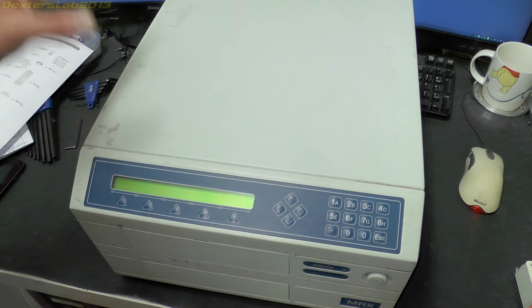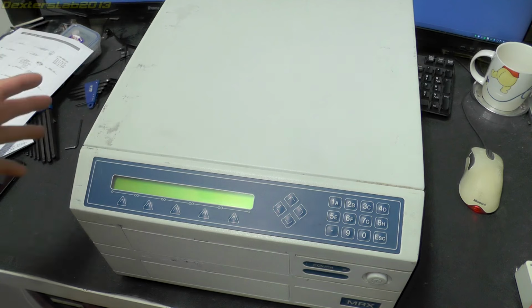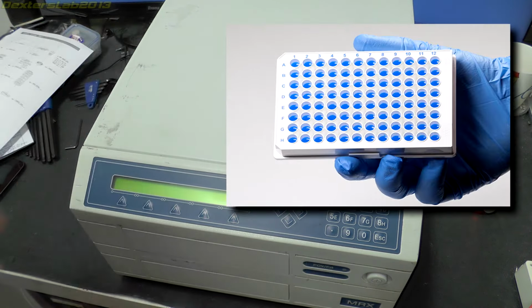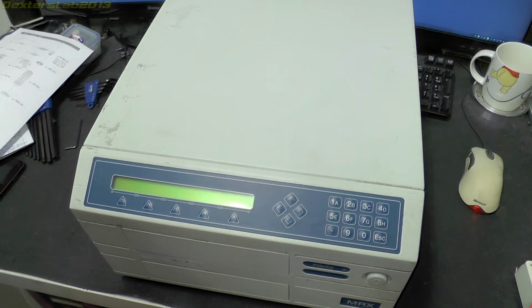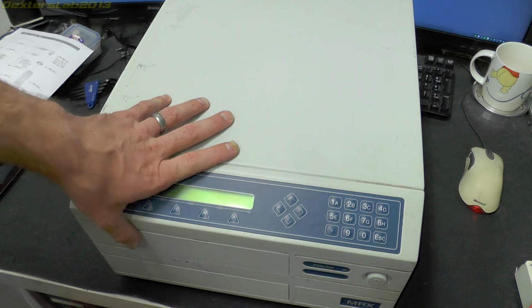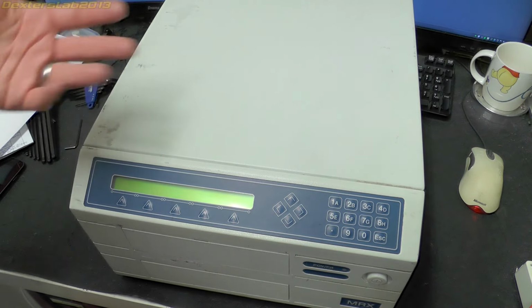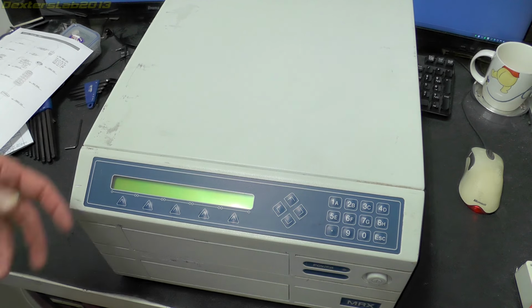Now what it actually does is takes a microplate, which is a small thing with little wells in it, and you might have seen them in TV programs and things. You put samples, liquid samples, into the microplate, and then you place it into the machine, and the machine analyzes them and gives you some data about the actual samples that you've put into it.